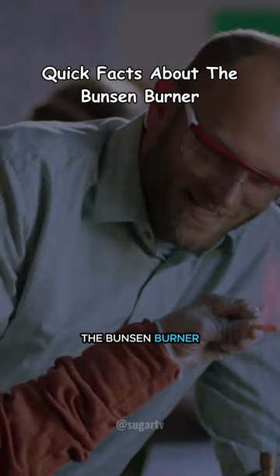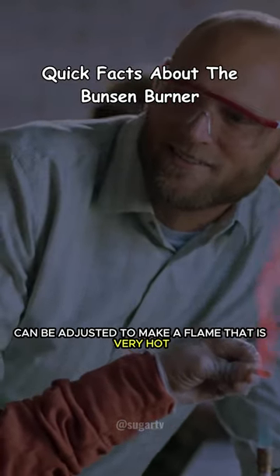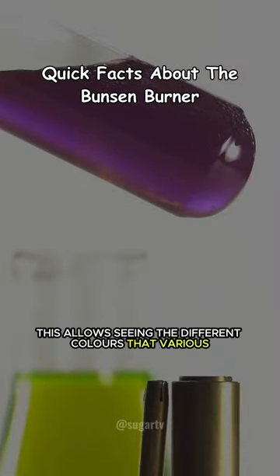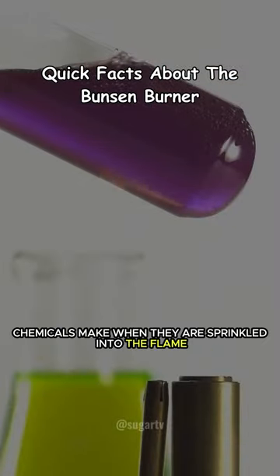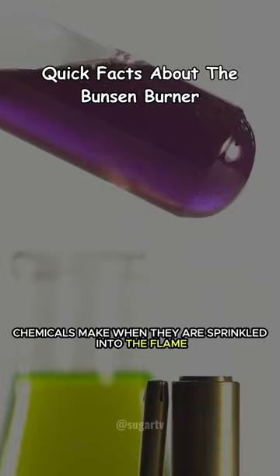The Bunsen burner can be adjusted to make a flame that is very hot without making much light. This allows seeing the different colors that various chemicals make when they are sprinkled into the flame.